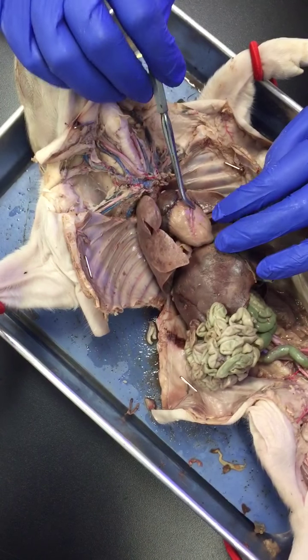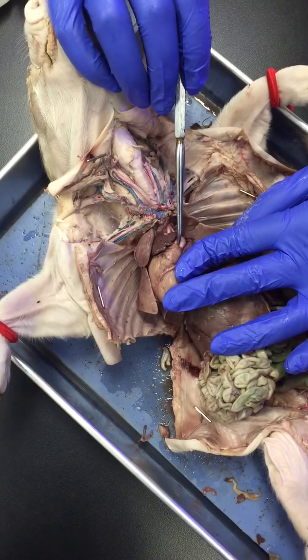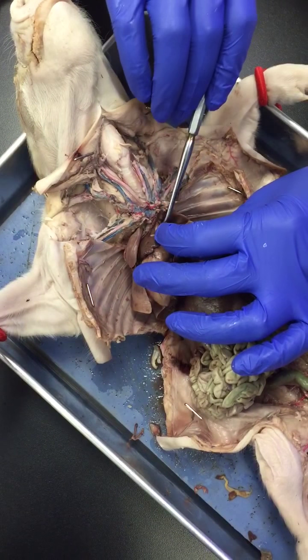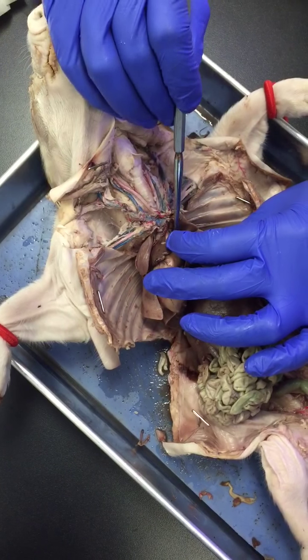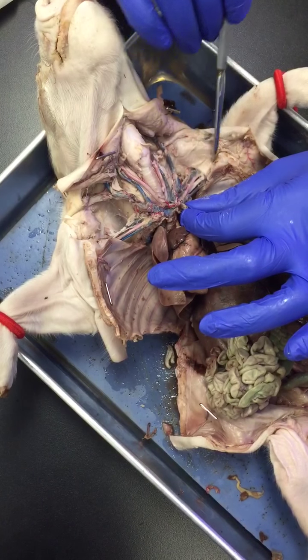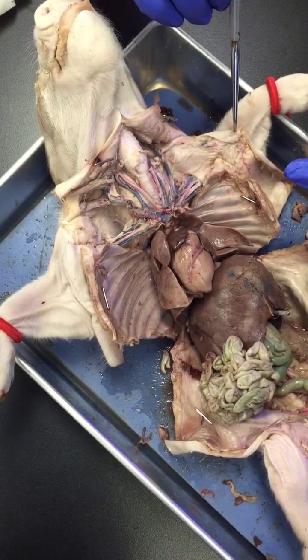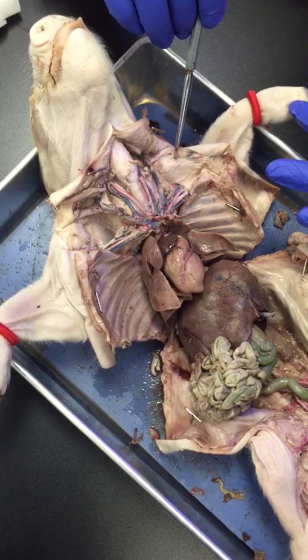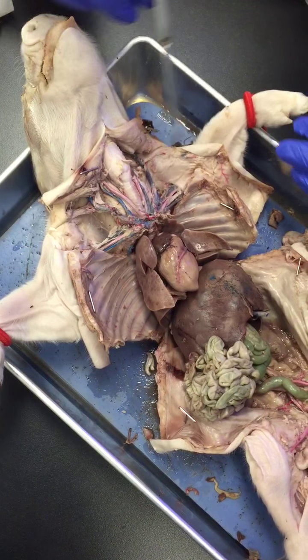So this is the heart, coronary artery, right? Now this is the aortic arch, okay? Now the aortic arch branches into, the first branch is the left subclavian artery. The left subclavian artery is going to give blood to the left forelimb, okay? Once it comes into the left forelimb, it changes names. So it's subclavian, subclavian. When it hits the shoulder area, it becomes axillary. And when it comes to the outer part, it becomes brachial, okay?